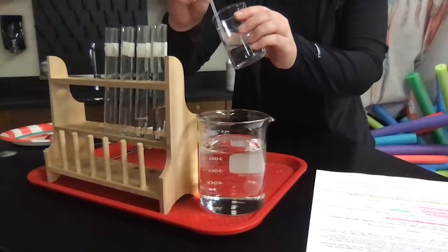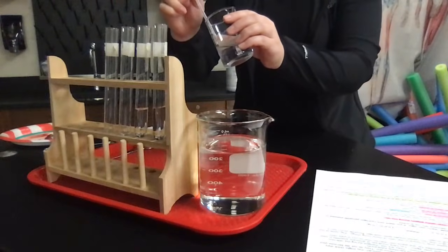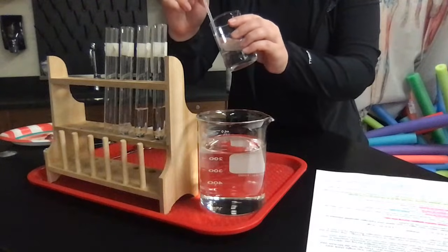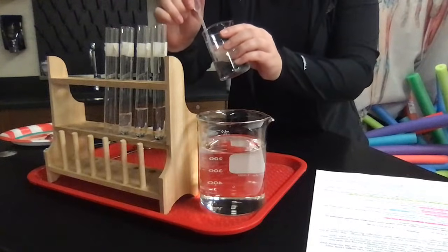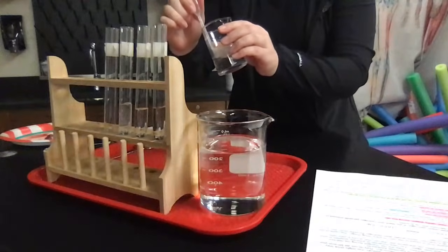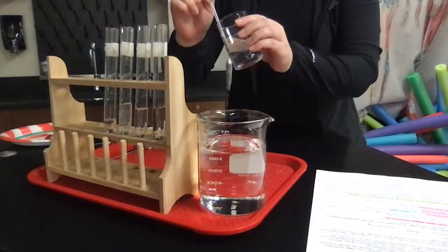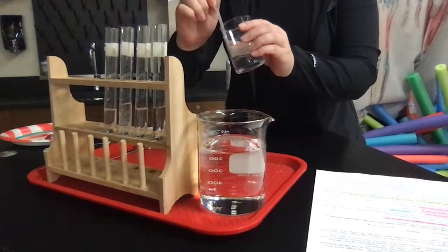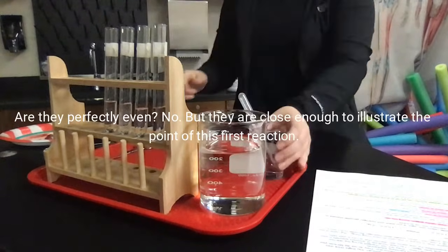So we have a couple different samples that we're going to be utilizing for this lab. We have a potato, we have a carrot, and we have bovine liver, which is liver from a cow. Those are going to be the 3 samples that we have of our enzyme, catalase, and we're going to see the catalysis reaction or the catabolic reaction. Remember that catabolic, cats have claws and they like to tear things apart. So catalase, ASE, tells you that it's an enzyme, and catalase is going to be breaking down this hydrogen peroxide and turning it into oxygen and water. So that's roughly 5 mils in each one of these.